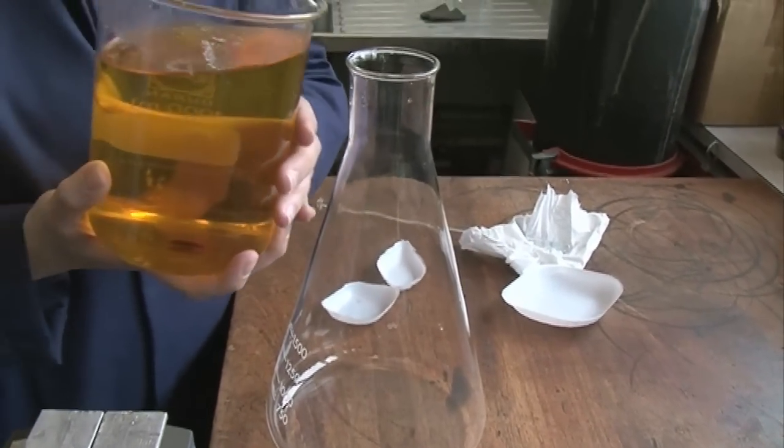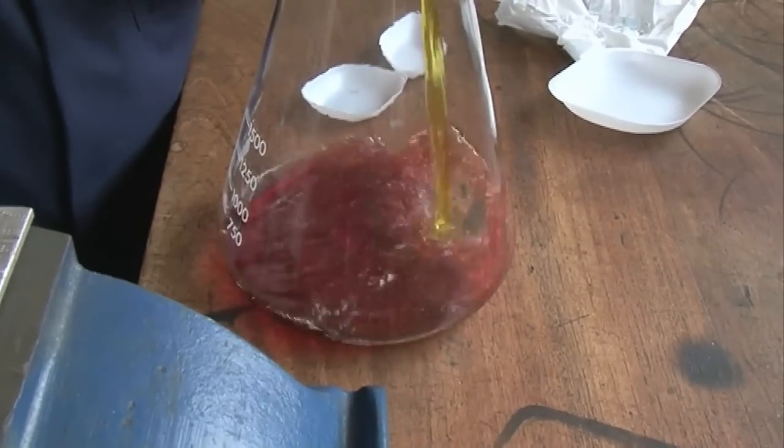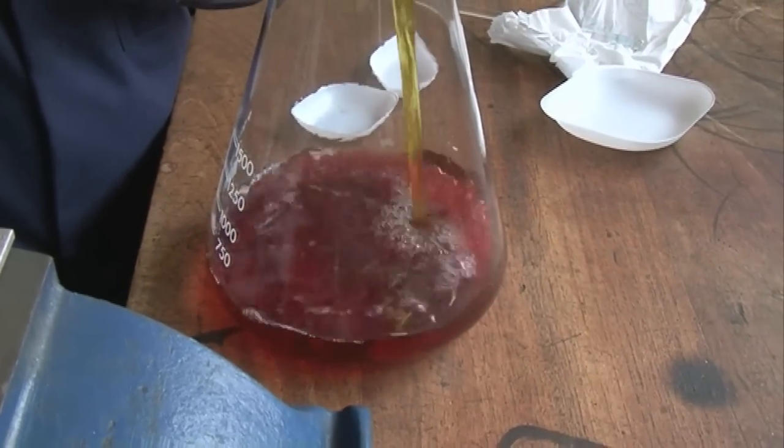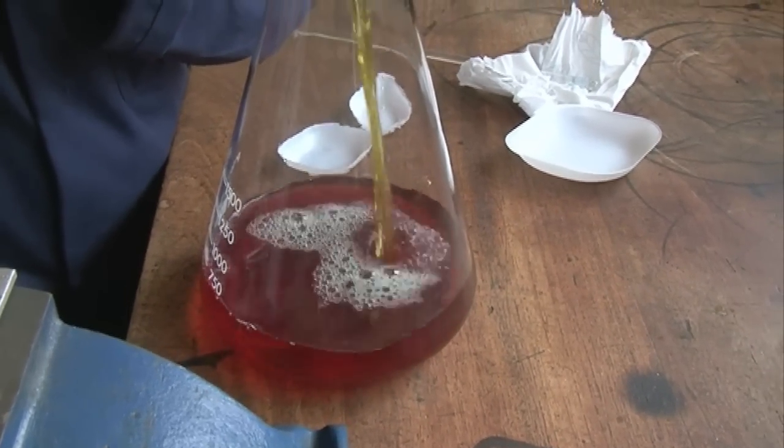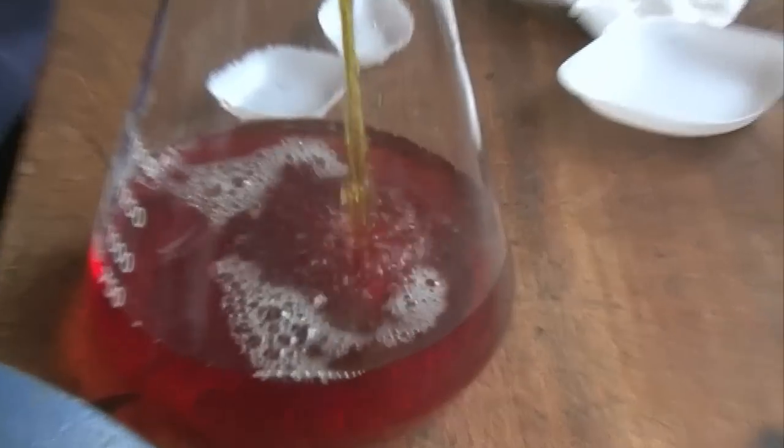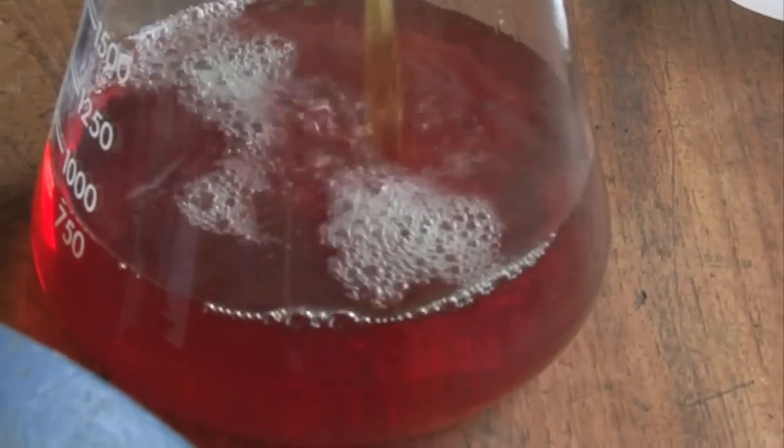Yellow in my hand and as it goes in, it's red. The reason why it's doing that, and you can see the bubbles there have a slight green tinge, is because we're adding oxygen into the mix.